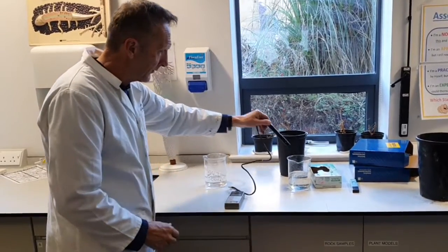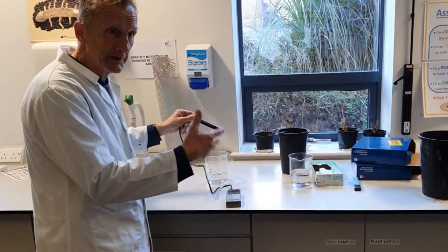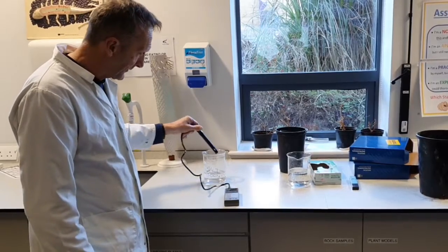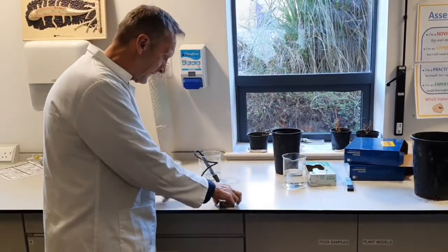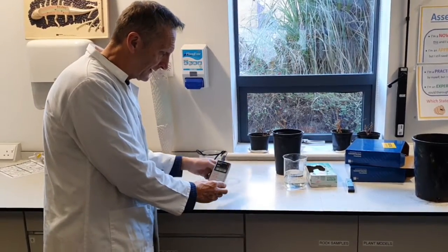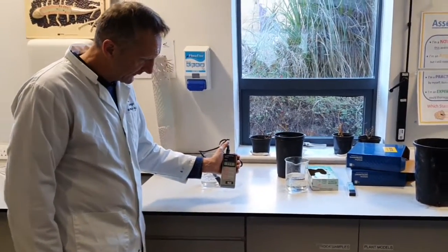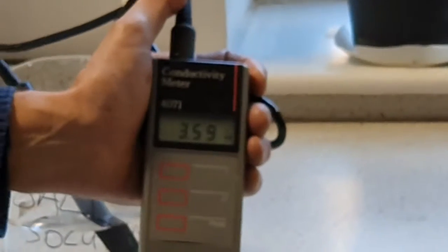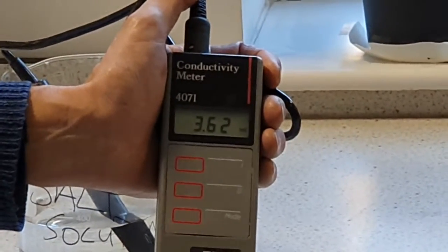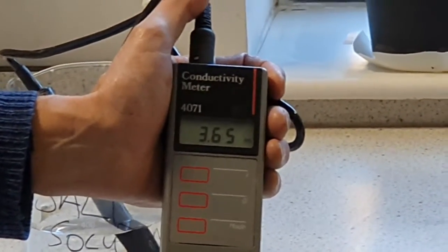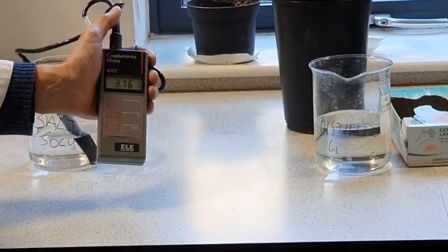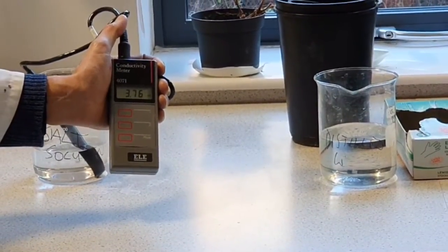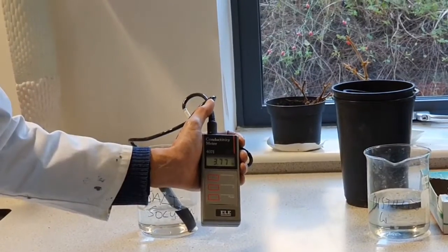Imagine that's in the sink. We put the probe—it's been in distilled water—into the solution where your hydroponic solution is, and we're going to take a reading. In this case, the reading is settling about 3. Let's wait for it to settle. I reckon it's going to settle around 3.78, somewhere about there. Could even hit 3.8.